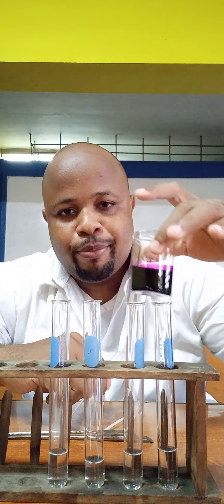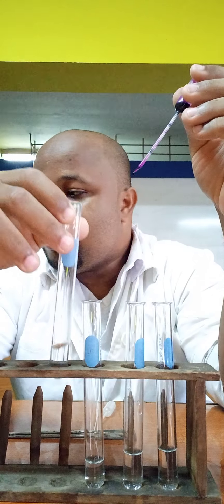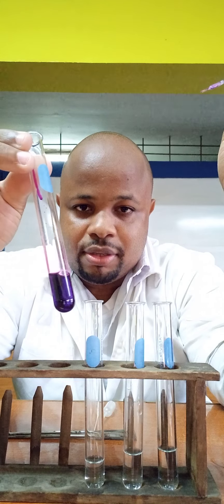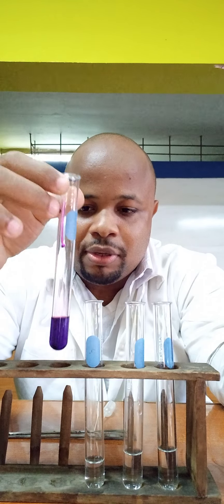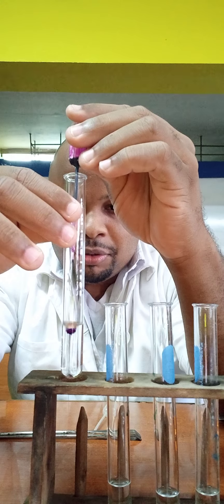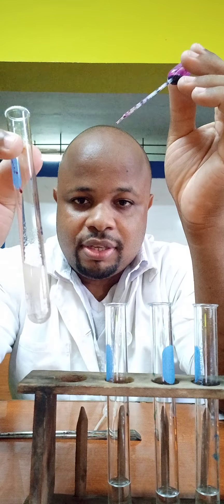We're going to start with potassium permanganate. I'm going to add a few drops to the first test tube — this one we're calling liquid B. I'll add five drops. Now let's go over to one of the test tubes of liquid A and add five drops as well to see what happens.